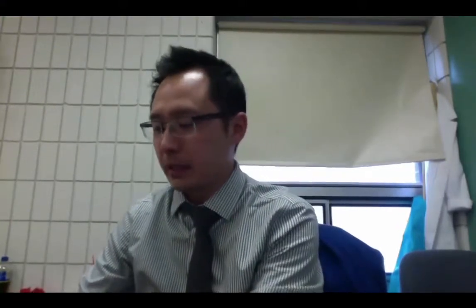So here's my little bit of vinegar in this beaker. I'm going to take my blue litmus paper and I'm going to take one out. And at this point, maybe you can sort of anticipate which one will change color and which one won't. So here's my blue and here's my red.